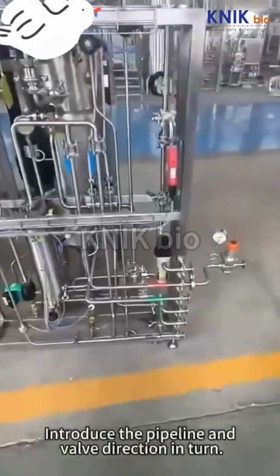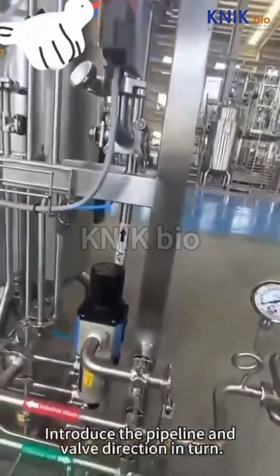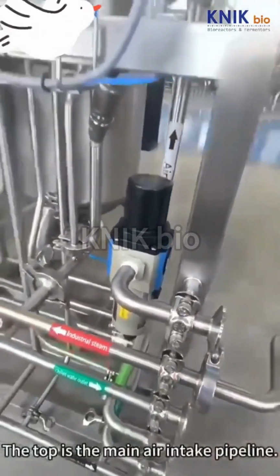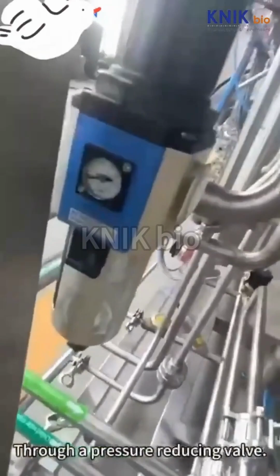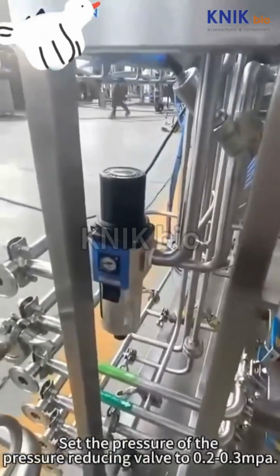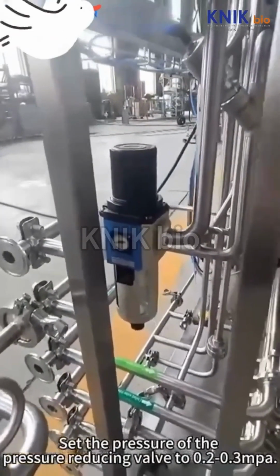Introduce the pipeline and valve direction in turn. The top is the main air intake pipeline. Through a pressure-reducing valve, set the pressure of the pressure-reducing valve to 0.2 to 0.3 MPa.